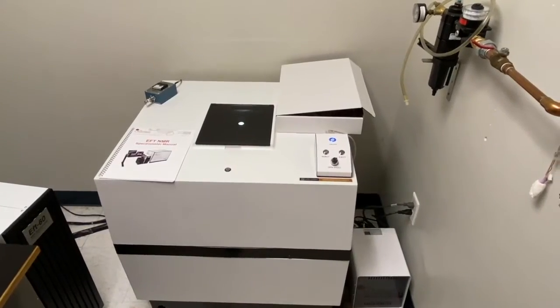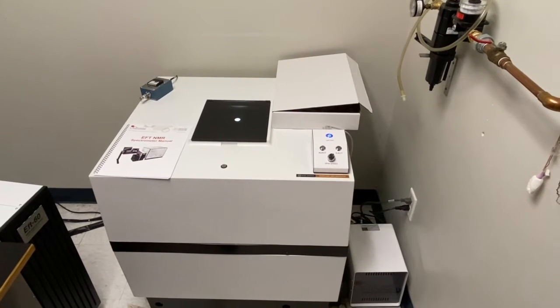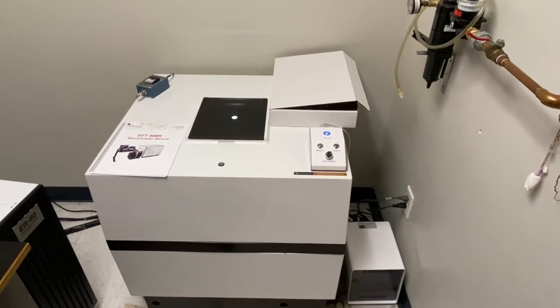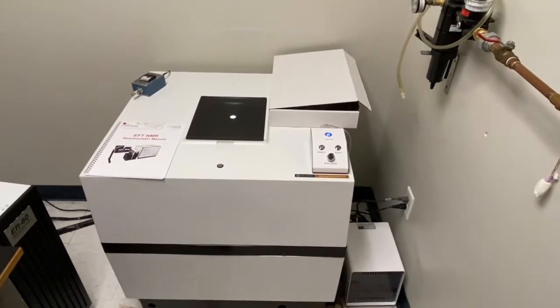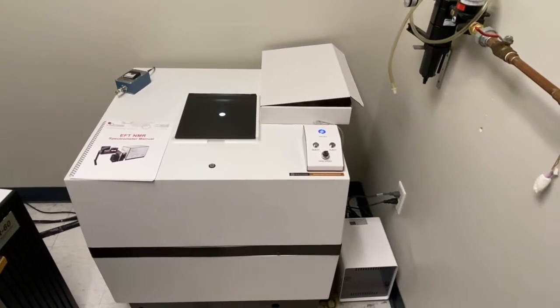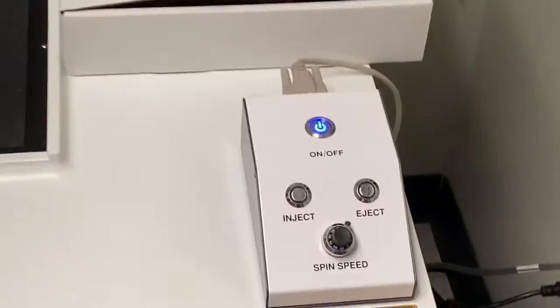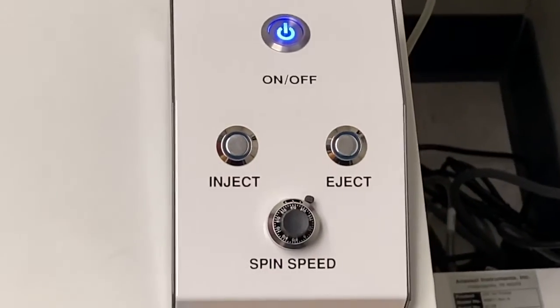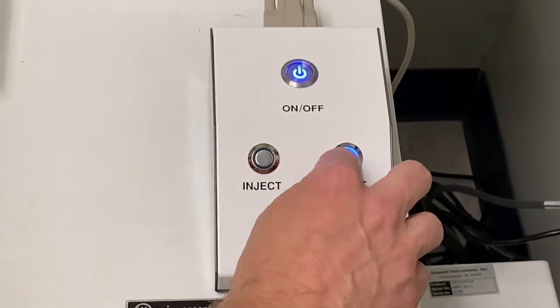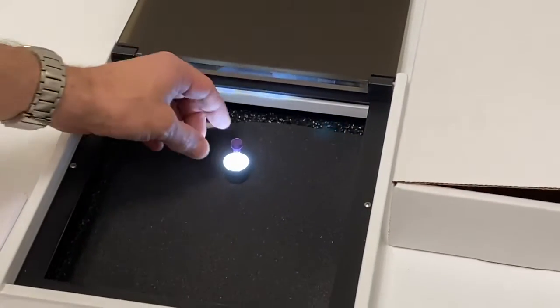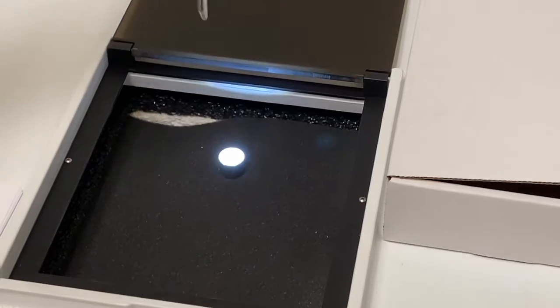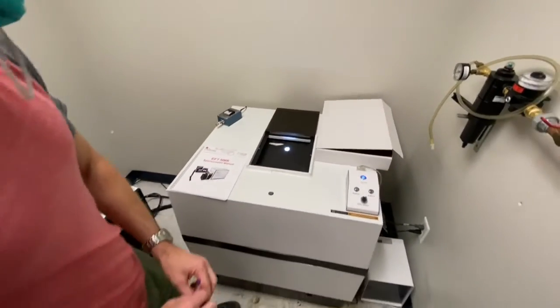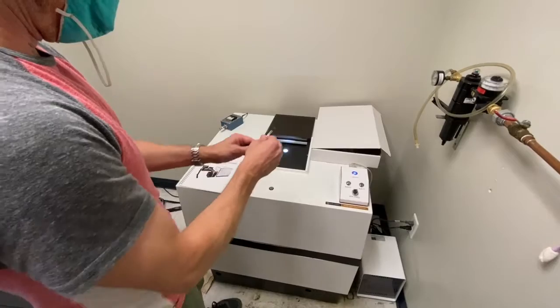This is the NMR room and you're looking right now at the magnet which is where your sample will go. There will probably be a sample already in there and so you'll have to eject it first. There's a button for the ejection and the injection and you'll hit eject and then it will pop out of that lighted tube. You'll lift it out and then take off the spinner.